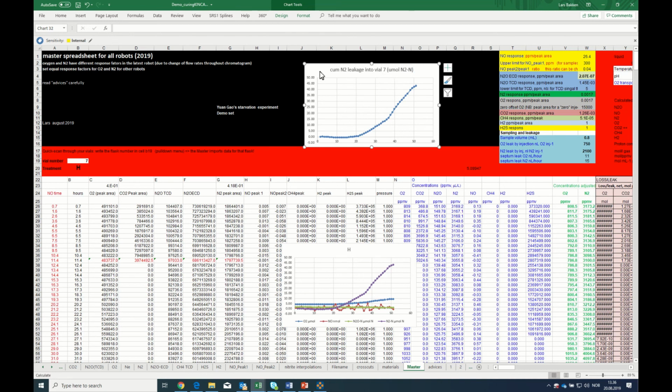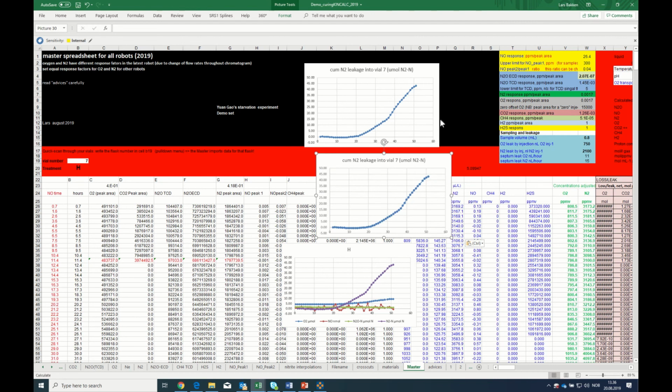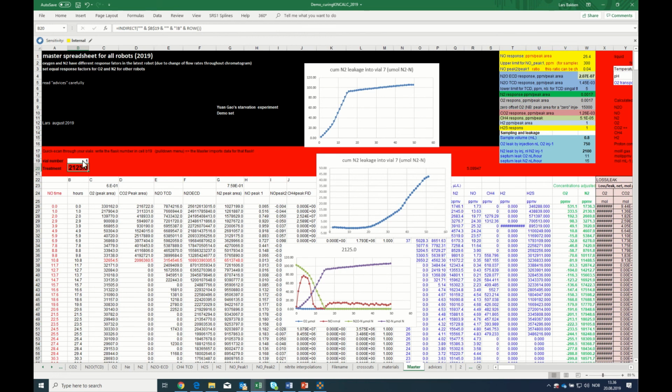Now I want to compare this with the others. So if I copy this one and paste it as an image, I have it retained. And now I can go to one of the other vials, number 1 for instance, and here you see the accumulated N2 production in vial number 1. After 15 hours, it levels off and increases only slightly. So throughout the next 35 hours, I've accumulated only approximately 10-15 micromol of N2. This title is no longer relevant because this is my vial 1, right?